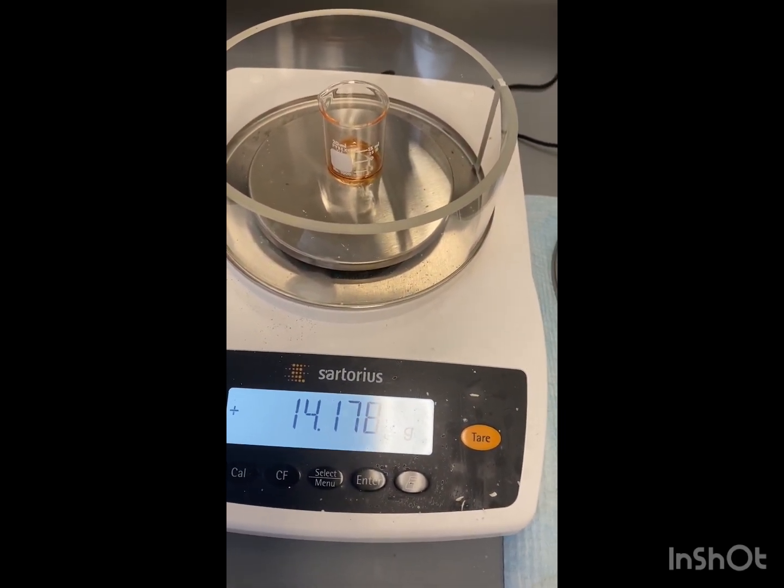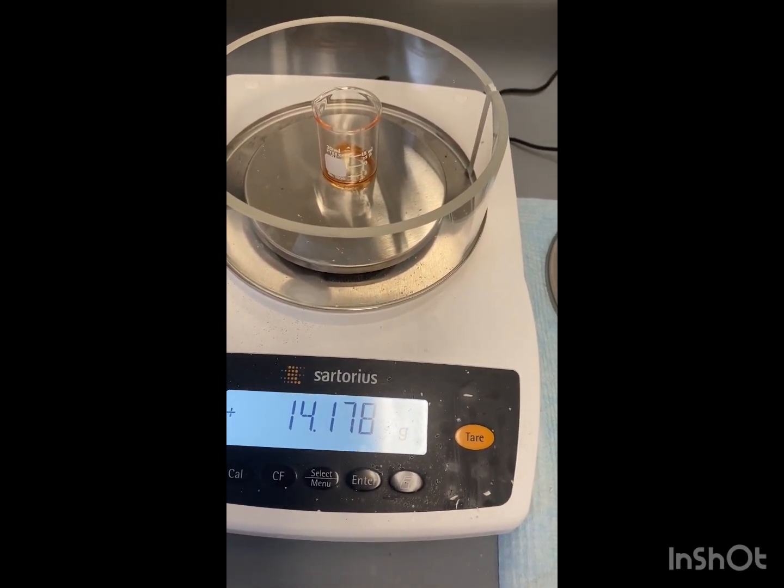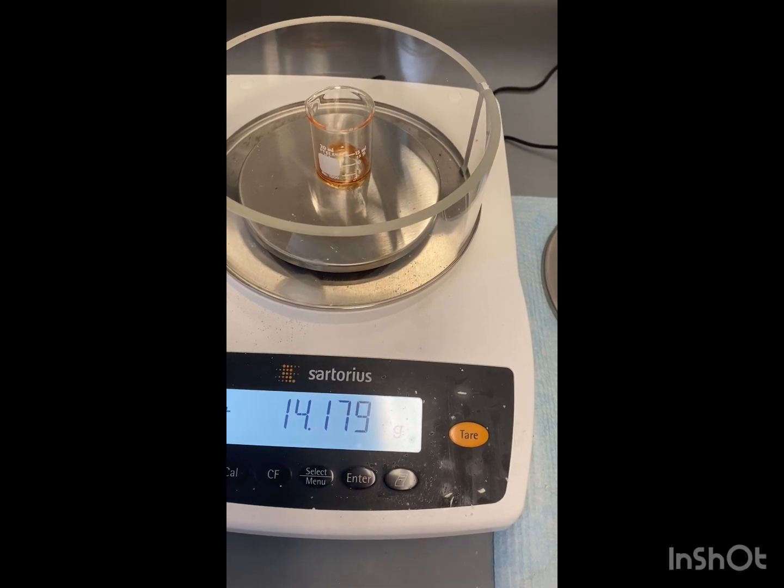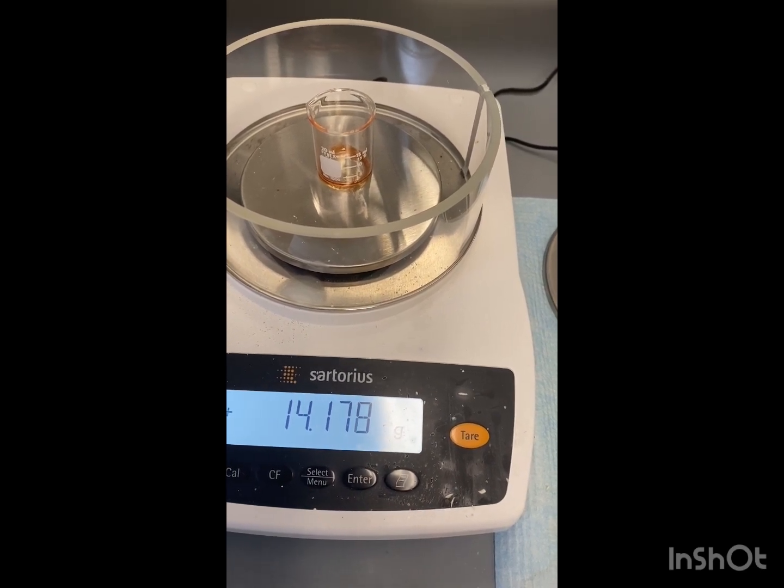We are now going to analyze the product by infrared spectroscopy and mass spectrometry. So take care of our product.